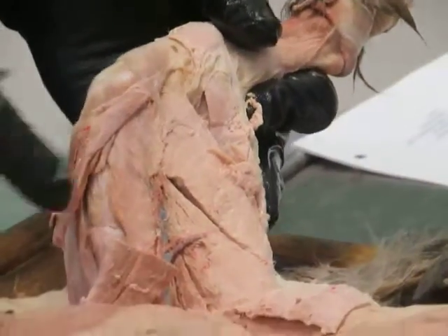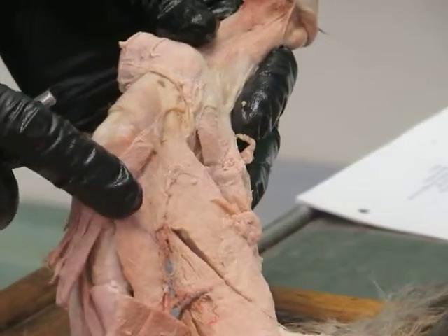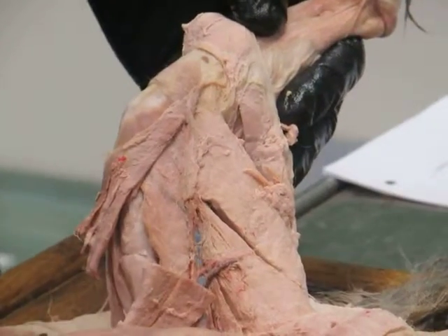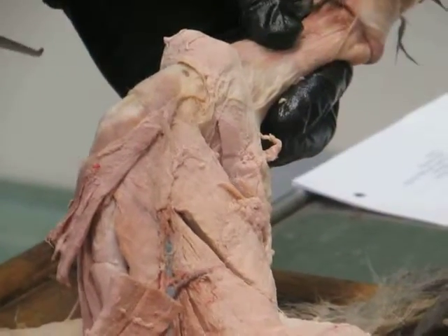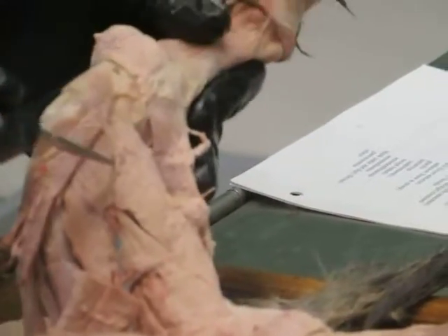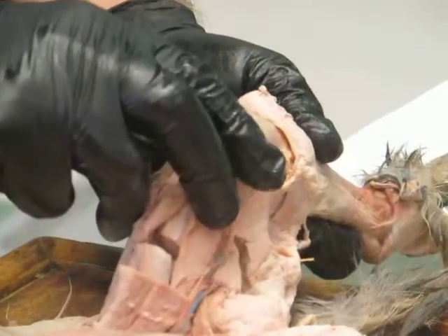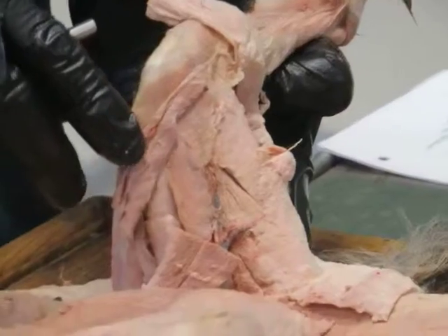Okay. They act primarily to do what at the knee, do you think? Flex or extend? Just take a look. Flex. Extend. Okay, try that again. Flex. Flex, yes. Okay, just think if this pulls, it's going to do that. So that's flexion at the knee. So these flex at the knee, what about at the hip? Are they going to protract or retract? Retract. I would agree.